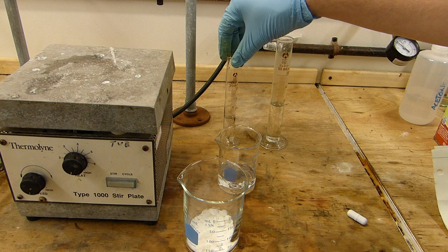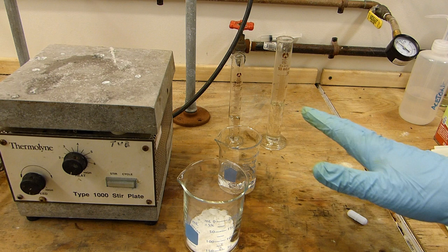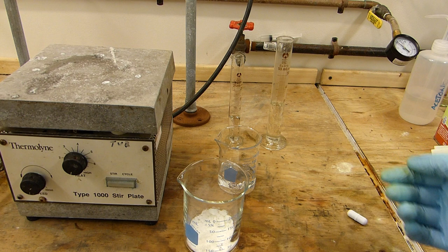And so of course to oxidize the hydriodic acid, I have 10 milliliters of 25%-ish hydrogen peroxide. Again it's old. It started as 29%. I'm guessing it to be about 25, so I have a little over 10 milliliters of it.